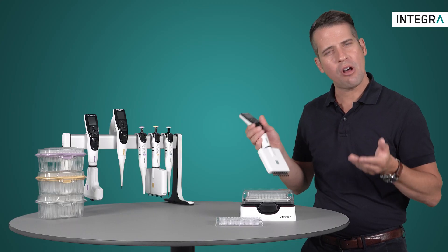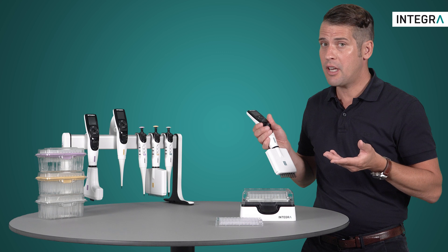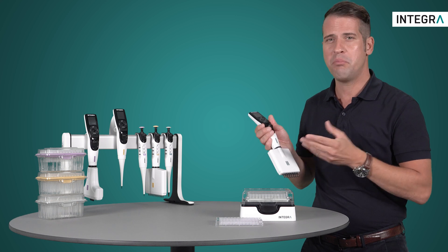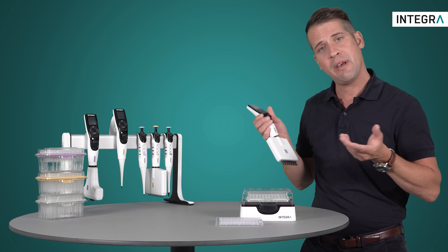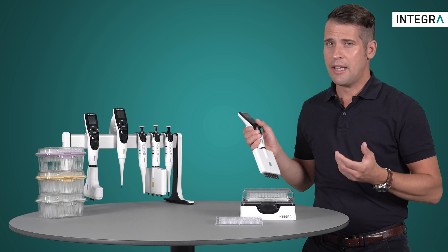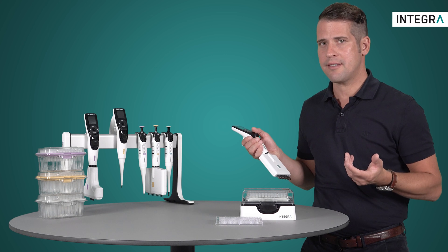This was just one small example of a custom program which can be used on the Integra electronic pipettes. But the possibilities are almost endless in terms of what can be programmed. Other steps which can be programmed include beeps, timers, blowouts with no dispenses, mixing, and tip spacing with the adjustable tip spacing Voyager. This really gives you total control over your most complex pipetting protocols, which will make these processes easier, resulting in less mistakes and better results.